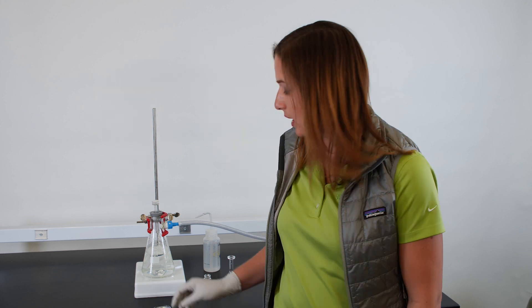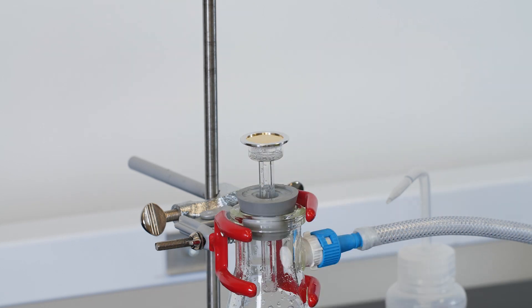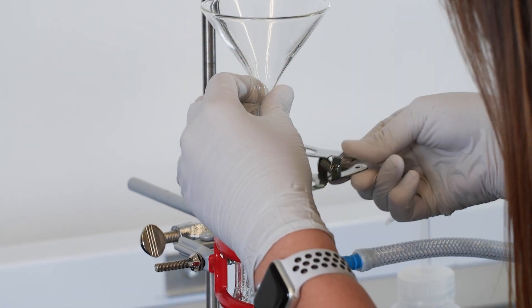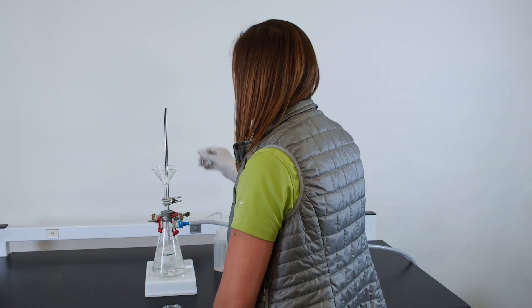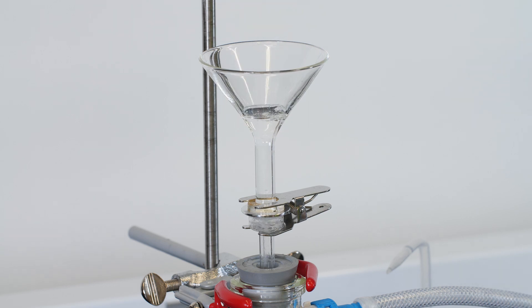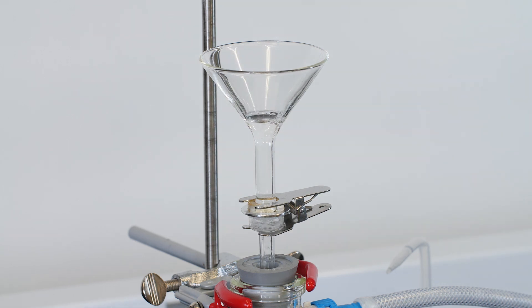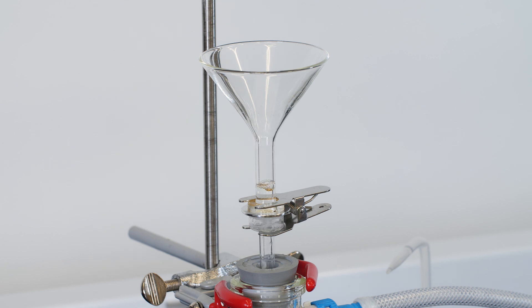If I have several particles or I just can't grab them, I can pour the entire sample through this filter round. That way, all of the particles are captured on the membrane.